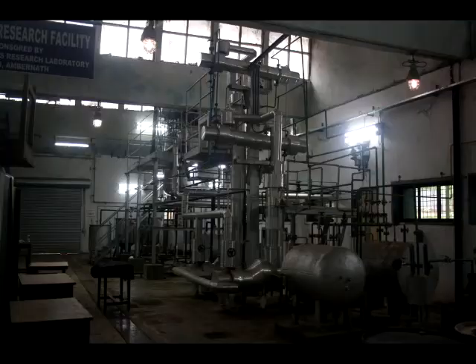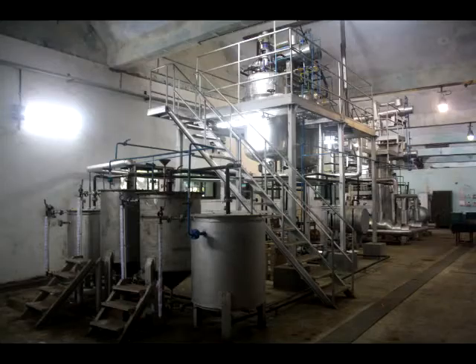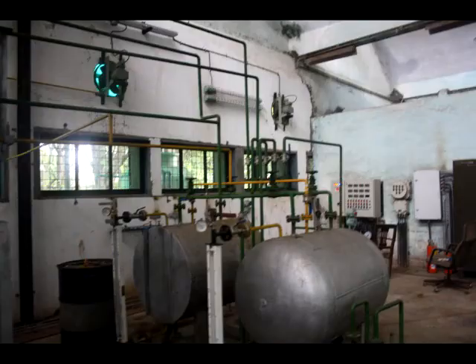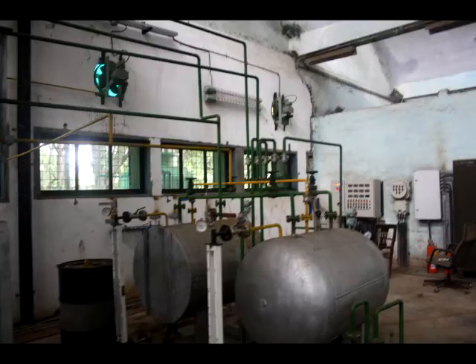Once we get biodiesel, we check its quality by performing various tests. These tests include the measurement of density, viscosity, pH, cloud point, pour point, and flash point. After these experiments, students will get a tour of the pilot plant which produces biodiesel.